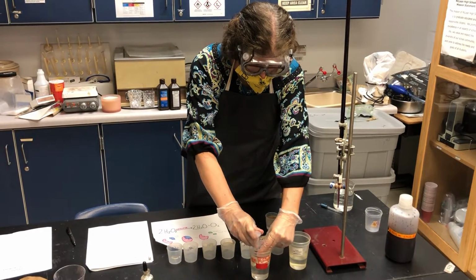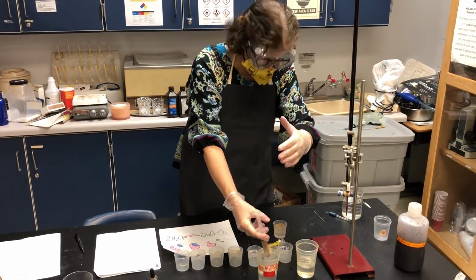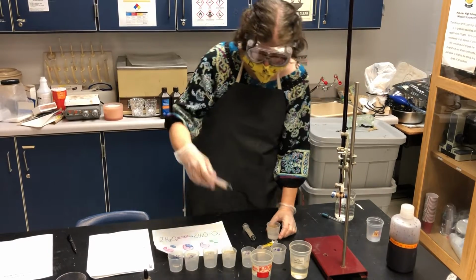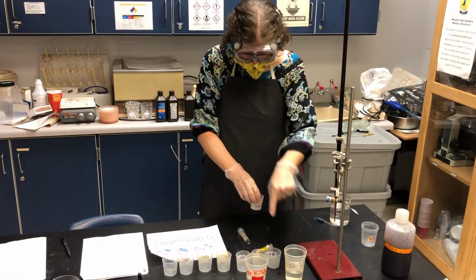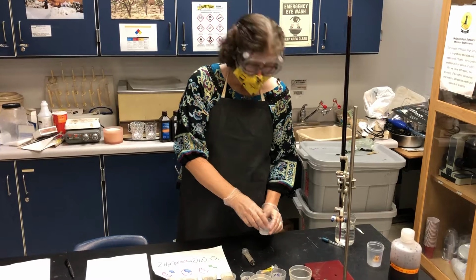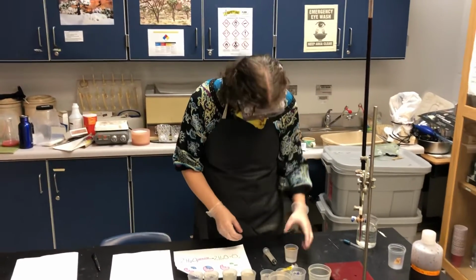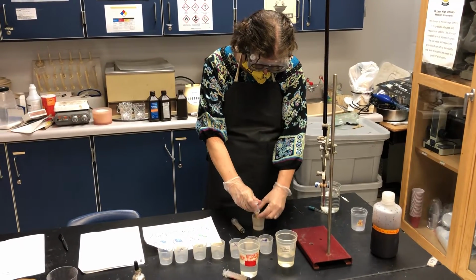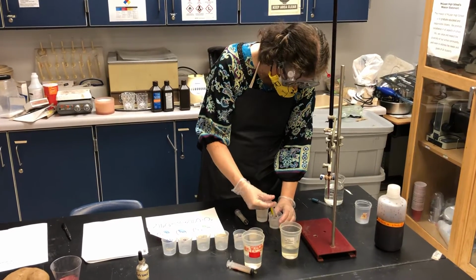And we are using the sulfuric acid as a way of stopping the reaction, because since we know that it will denature the enzyme, once we do have enzymes in there, that will give us a way of exactly timing how much time the enzyme has in contact with the substrate. Okay, so right now, that's all together. Now I'm going to titrate this, but I'm only going to titrate 5 mils of it, so we're not here all day.